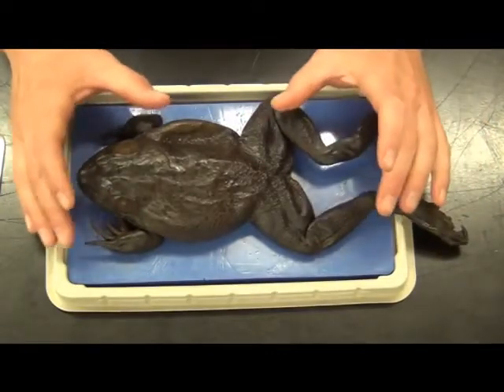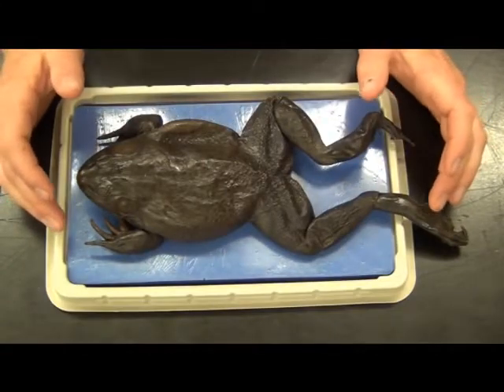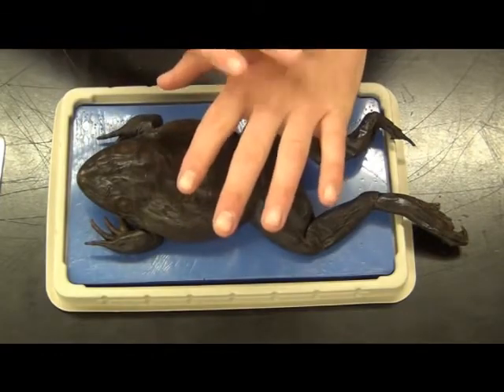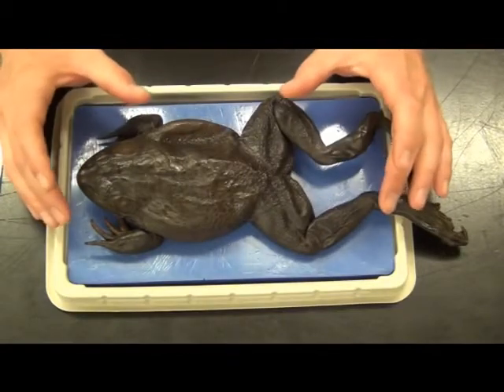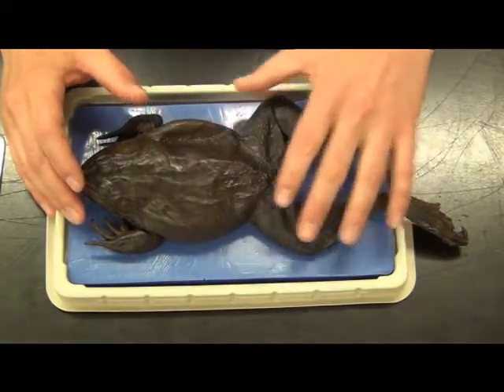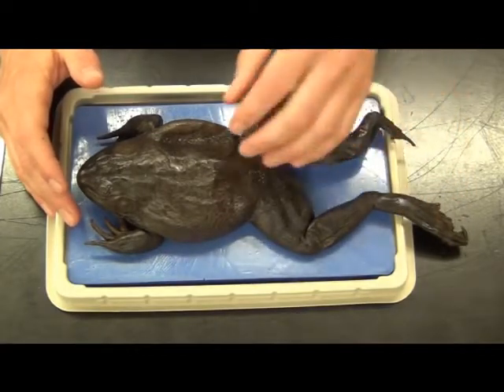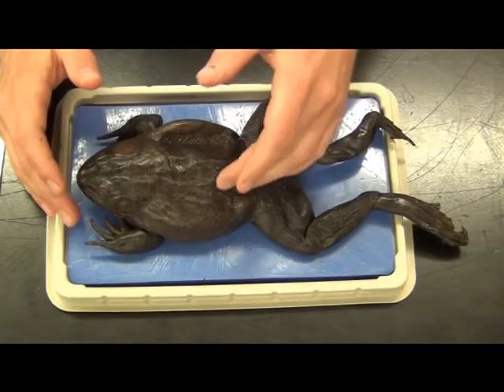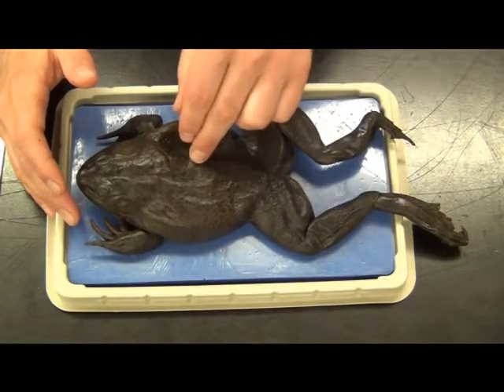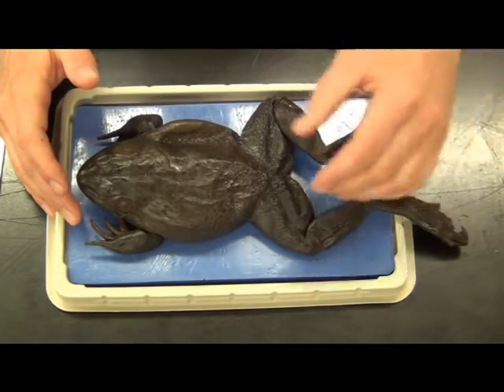Starting out with the skin — most frogs out in the wilderness are going to have very moist skin. This is an incredibly adapted and specialized membrane, more so than our skin, which allows things to stay protected — bad things stay out, good things stay in. For an amphibian, salamander or frog, this is literally an organ for breathing. Across the entire frog, 40 to 60 to 70% of breathing happens across this membrane — the oxygen in and the CO2 out that we usually do with our mouths and lungs. In amphibians, the majority of this is done on the outside. So already you've got some neat semi-aquatic adaptations.